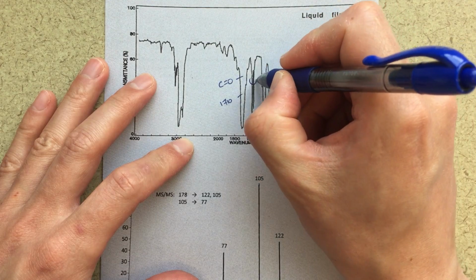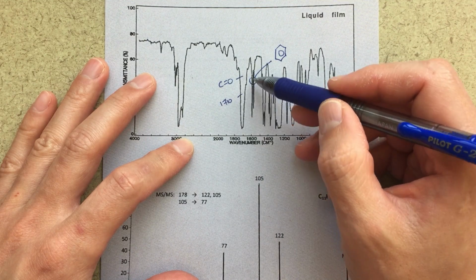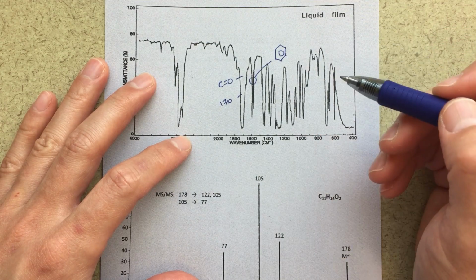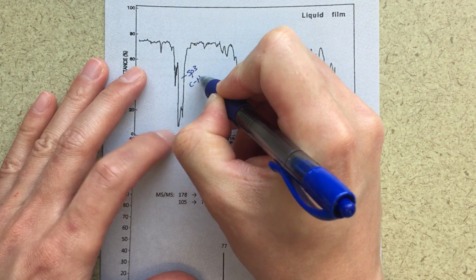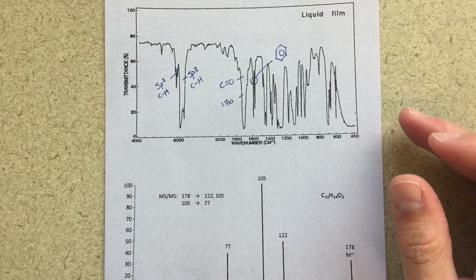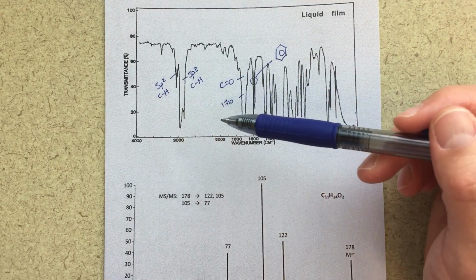Right next to that here, we've clearly got an aromatic benzene ring. This 1600 is very indicative of this aromatic ring. So I think that that's a good starting point. Over here, we've got sp3 CH bonds, so right below 3000, and then right above 3000, sp2 CH bonds. If you have any practice with IR, especially if you're taking organic chemistry right now, I think you're getting really familiar with these sp3 hybridized CH and sp2 hybridized CH.